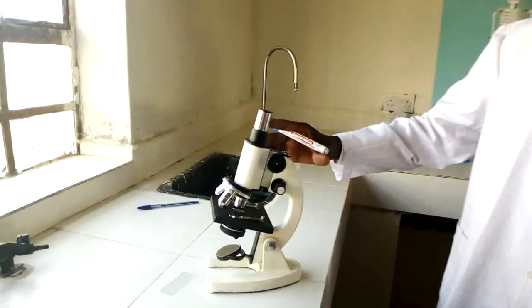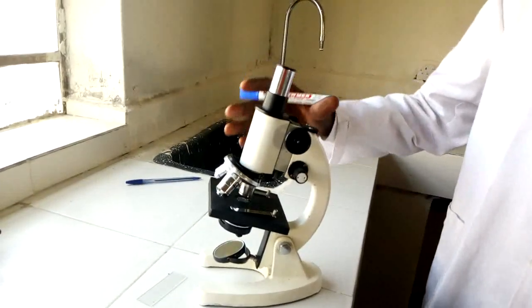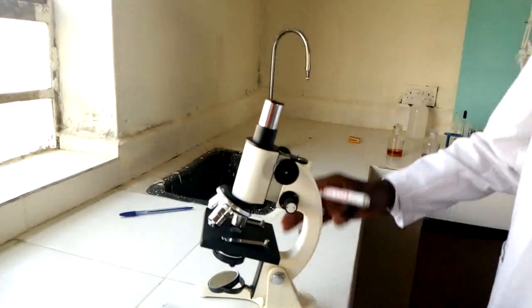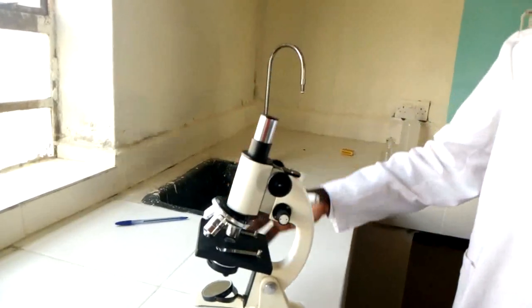My name is Teacher Ibrahim. Today we are going to look at the light microscope. It's here with me — I hope you are able to see it very clearly. The light microscope comprises various areas as you can see.